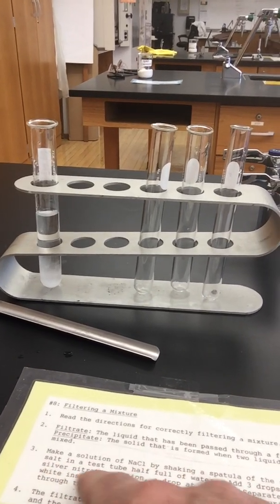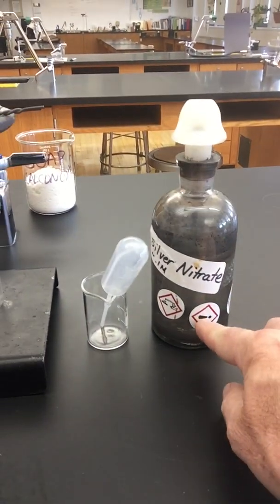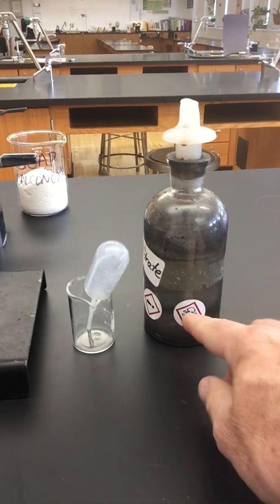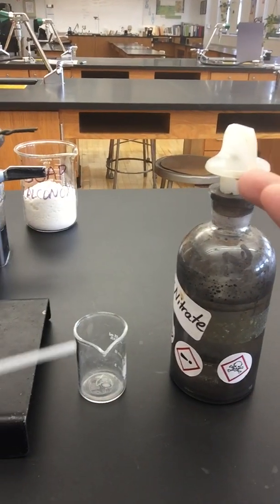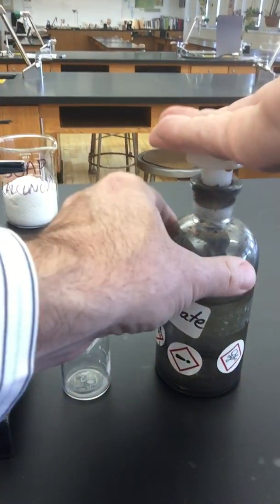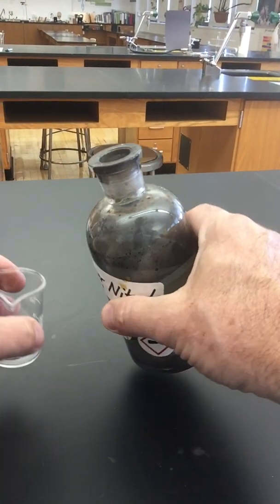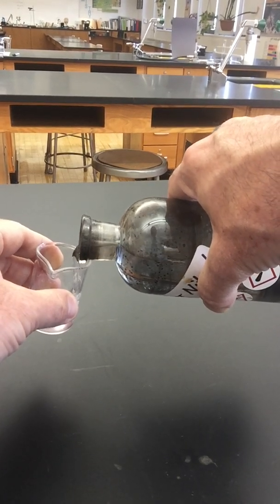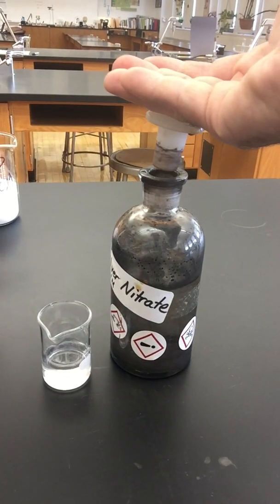Add 3 drops of a silver nitrate solution, a drop at a time. So over here, I've got silver nitrate. Silver nitrate is nasty. That's danger. That's corrosive. That's deadly. 3 different signs here. I'm going to use what I already learned. I'm going to take my hand, turn it upside down like that, take this off. This will probably already be filled for you, so you don't have to do this part, but I'm just going to put a tiny bit in here. I'm going to return the cap to it.